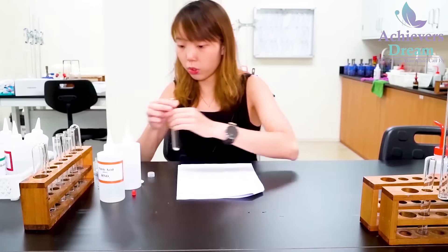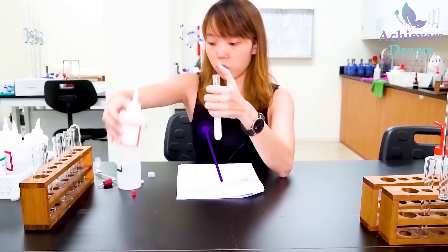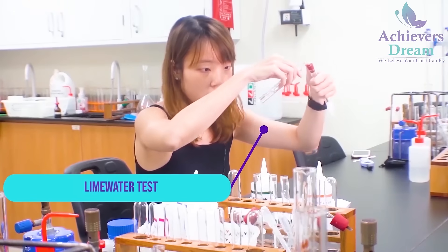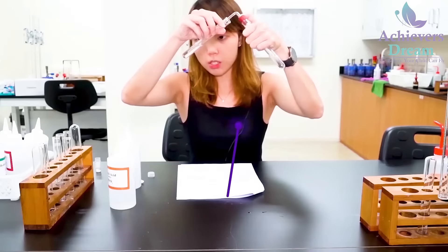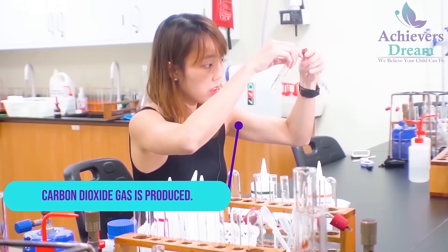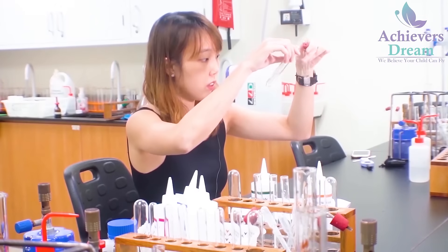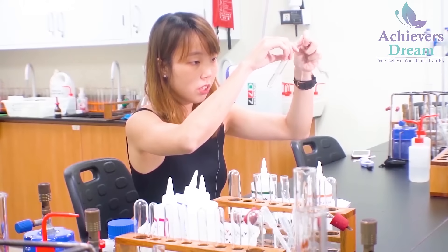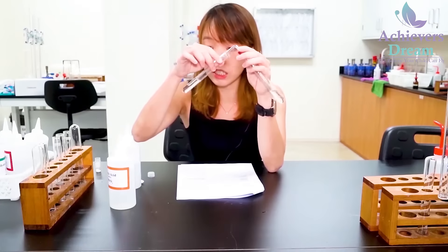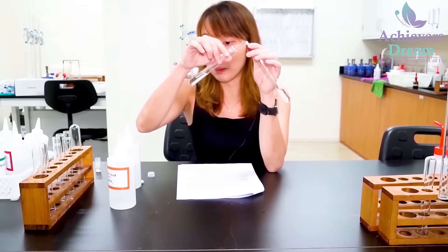I'm going to add in dilute nitric acid. Upon addition of dilute nitric acid, you notice that there's effervescence, so I'll be doing the lime water test. You notice that there is white precipitate when the gas is being bubbled through lime water. The observations for salt X: there is effervescence upon addition of dilute nitric acid, and this colourless gas produces white precipitate when bubbled through lime water.